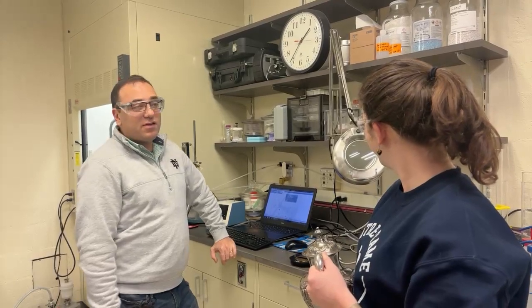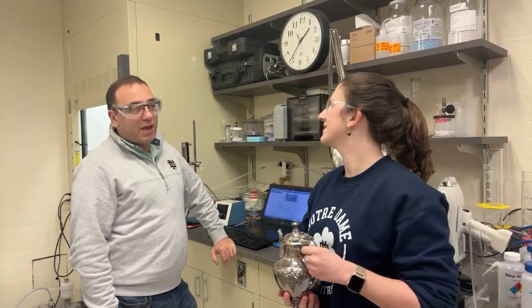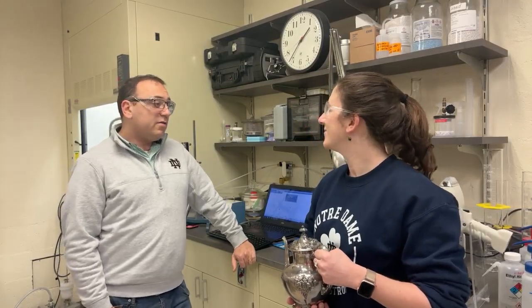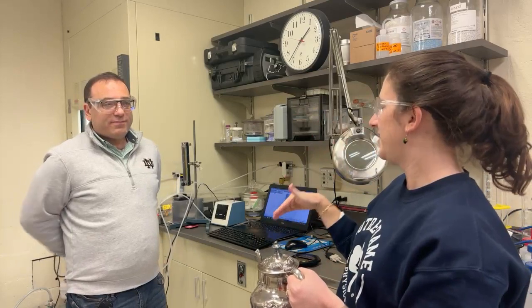because of the amount, probably whatever they make silver from contains some tiny amount of lead. If you look deeper, maybe in all materials you will find some amount of stuff that shouldn't be there, but it comes as a raw material. So there might be some lead. I would not say inconclusive. Definitely, it's much less than this one, but you know, it might have some, because that was a shallower peak. It's less intense.